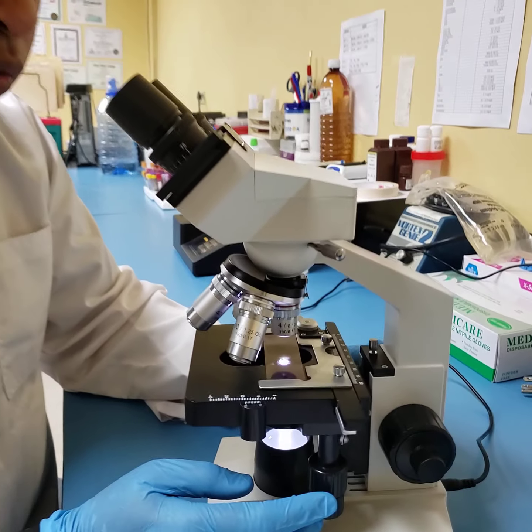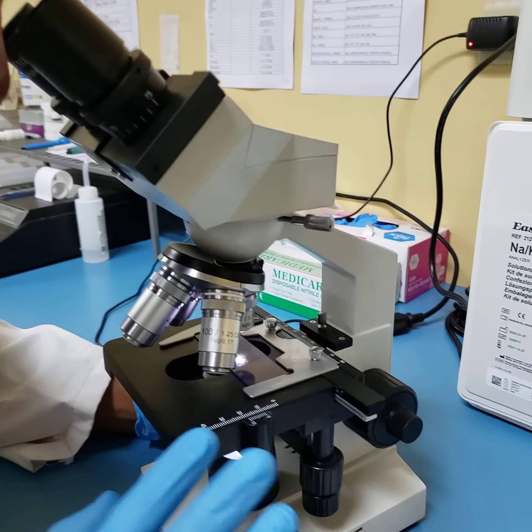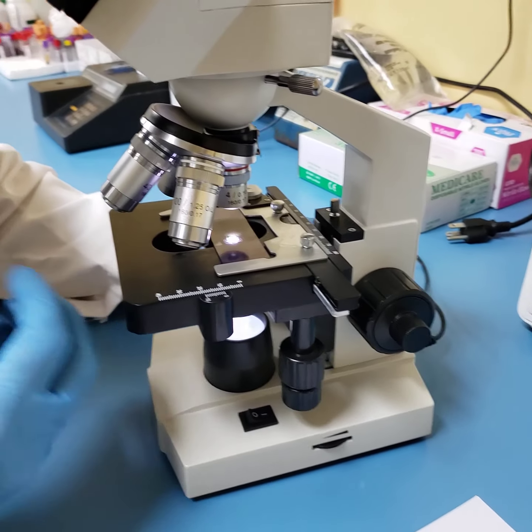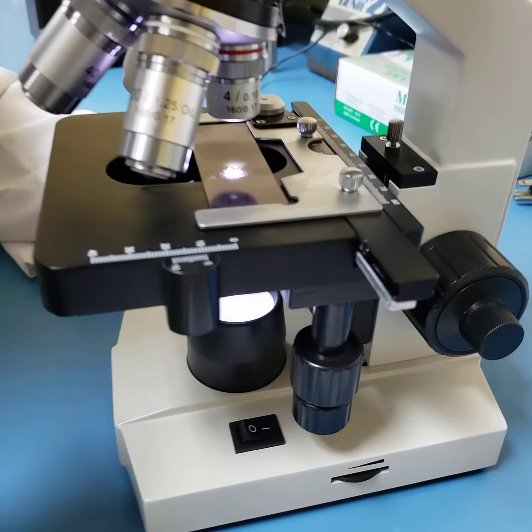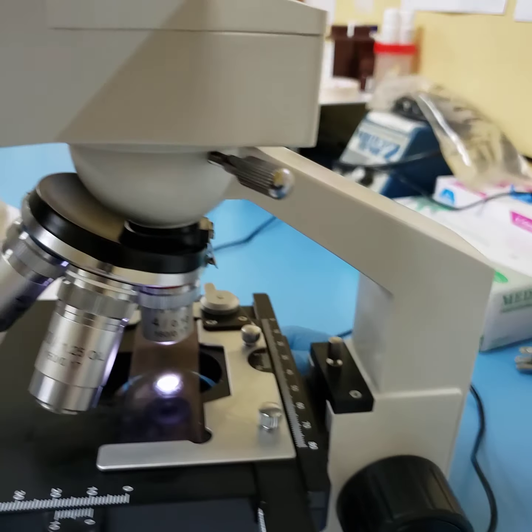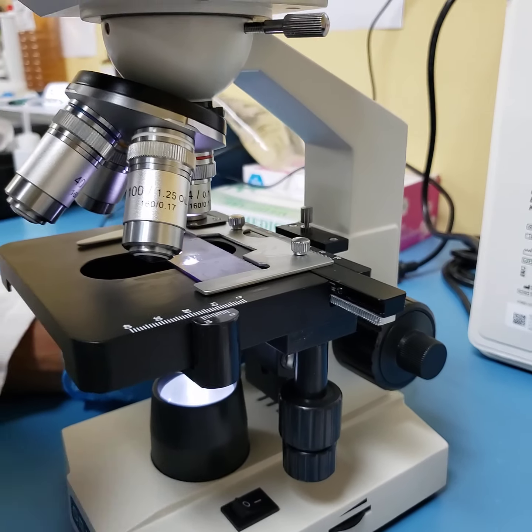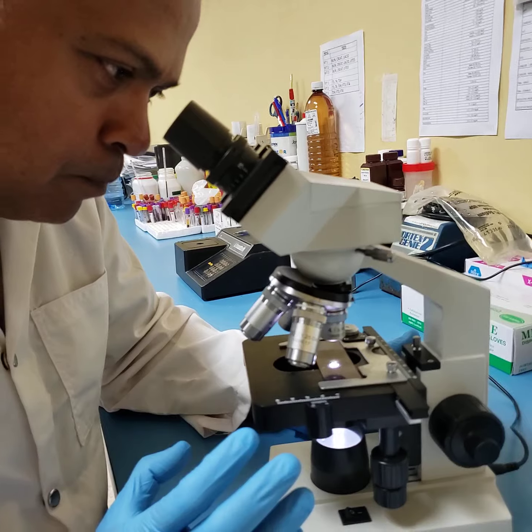At this point, students, I want you to know you will not be seeing anything. If the image was stained using a particular staining method, you might see the background of the image. You might see a purple color, you might see a red, you might see a pink, but you will not be seeing anything because no fine-tuning has been done yet.